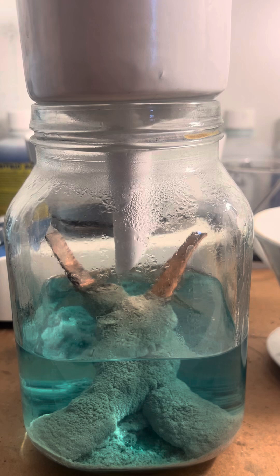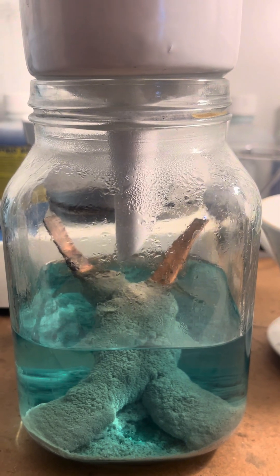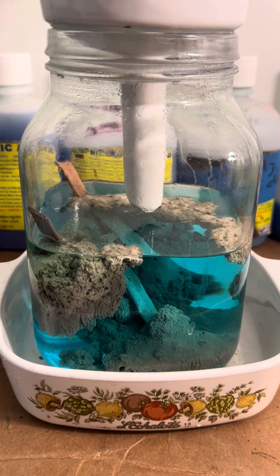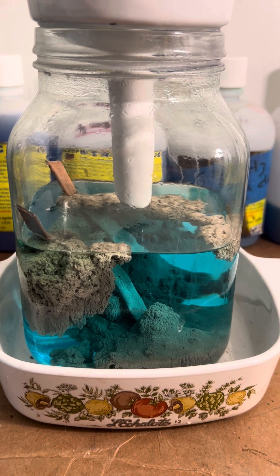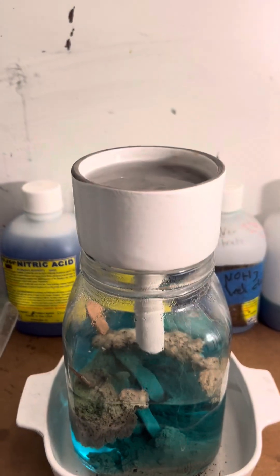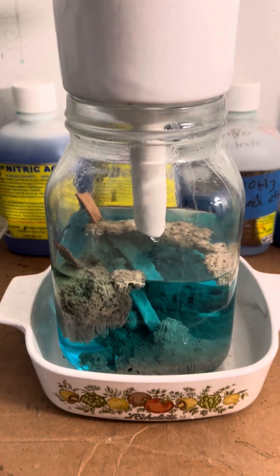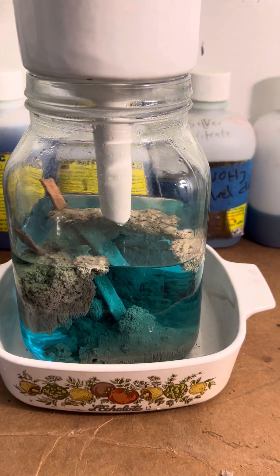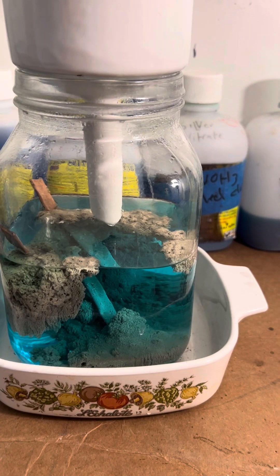But here we are cleaning this up. We'll draw that out and melt it up and have a little silver for the silver salt. We're going to rinse the filter and let that sit overnight. It looks like it's slowing down. I'll let it go until the morning — I'll probably stir it tonight and let it settle down. But there you go, that's all the silver from that silver chloride.